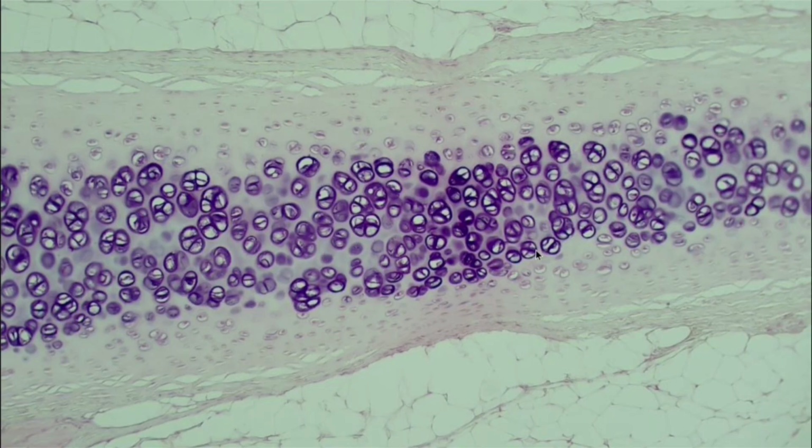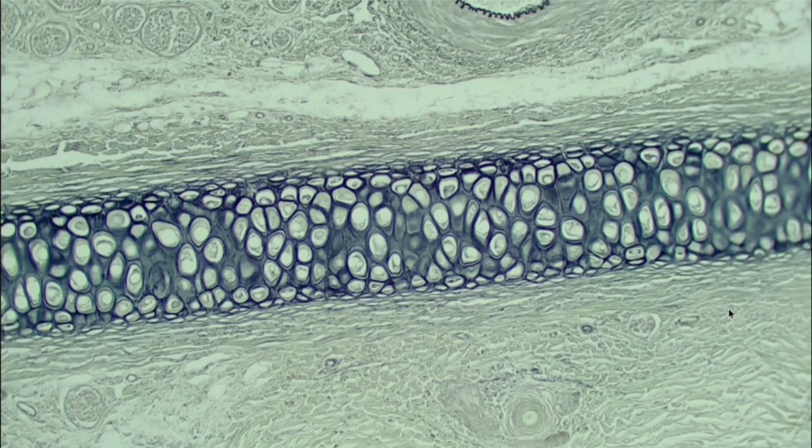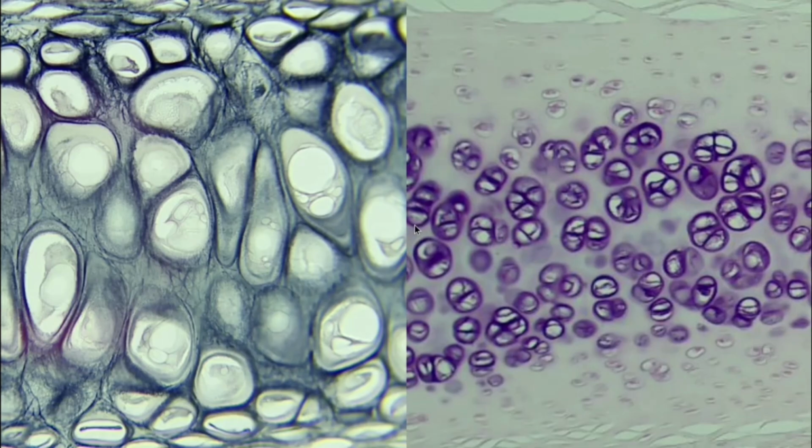And we're going to come up on a different slide here, our elastic cartilage. Some people get these kind of confused because they're similar in some ways, but I'm going to show you the difference. But again, we're just looking at this right here primarily to help us identify this tissue type, this kind of rectangle right here. You can tell there's still these holes, there's still this texture right here, but let's look at this closer. Right? So the way we can tell these apart is that our elastic cartilage is going to have these fibers, right? They're really pronounced. They're really there. We can tell it's like these spider webs again, right?